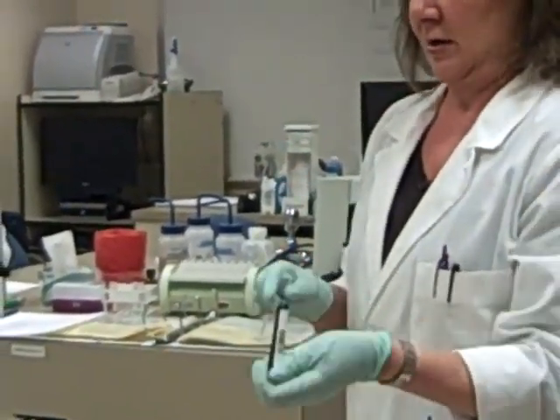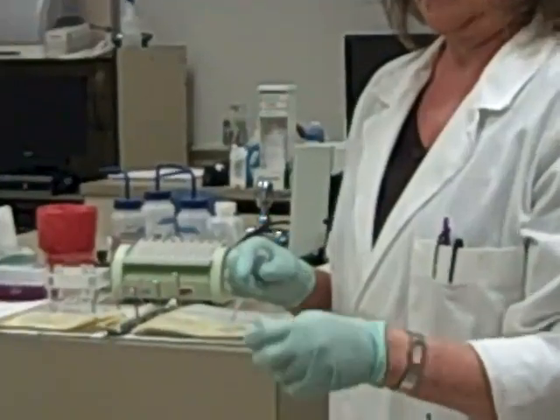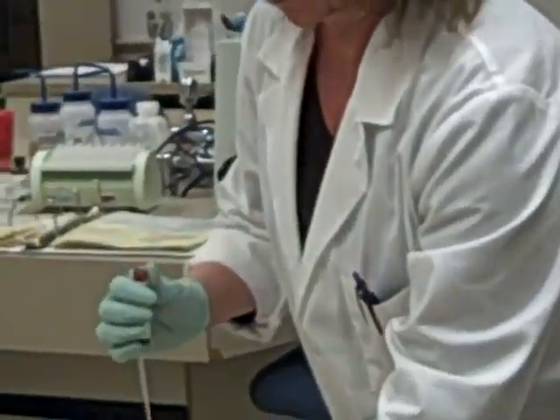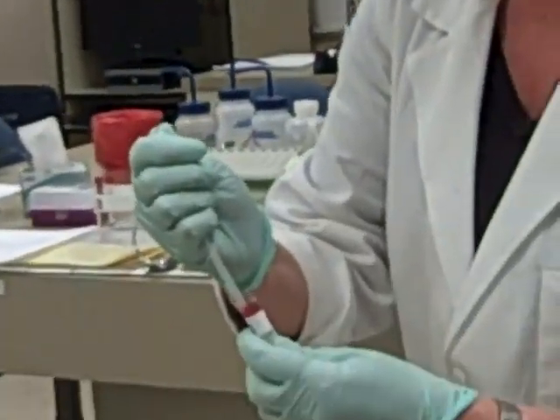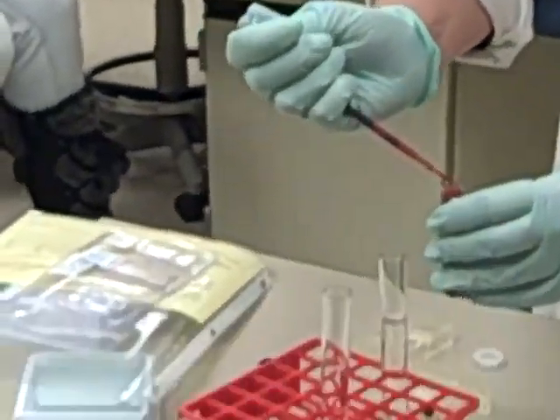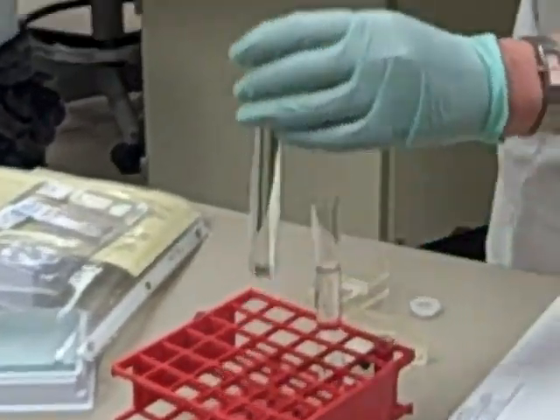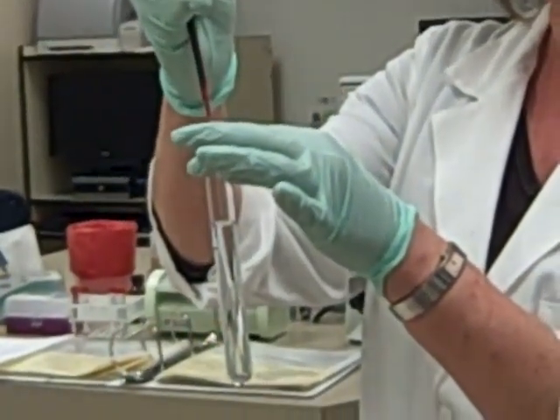What I'm going to do is put in just 1 drop of blood.